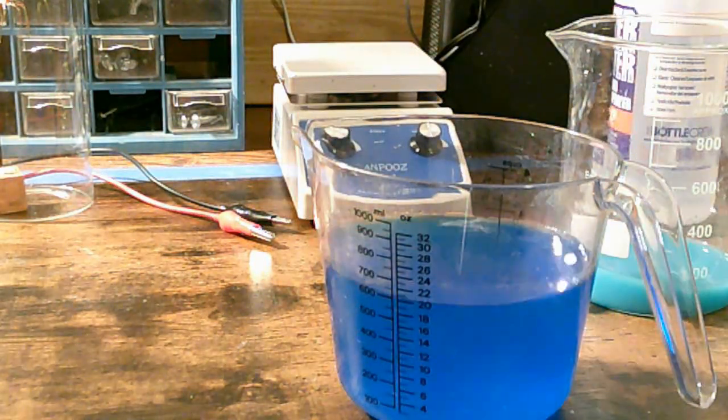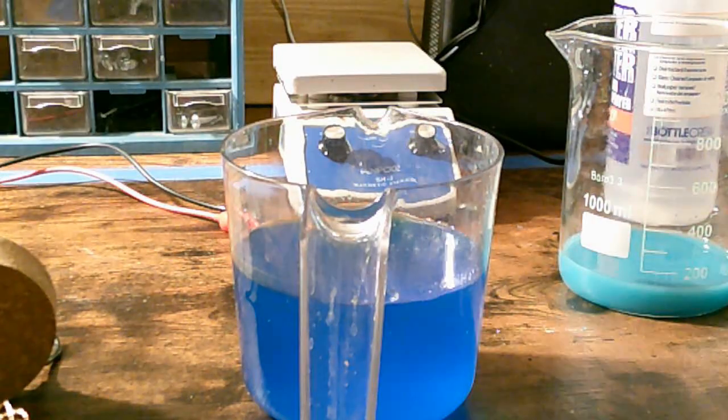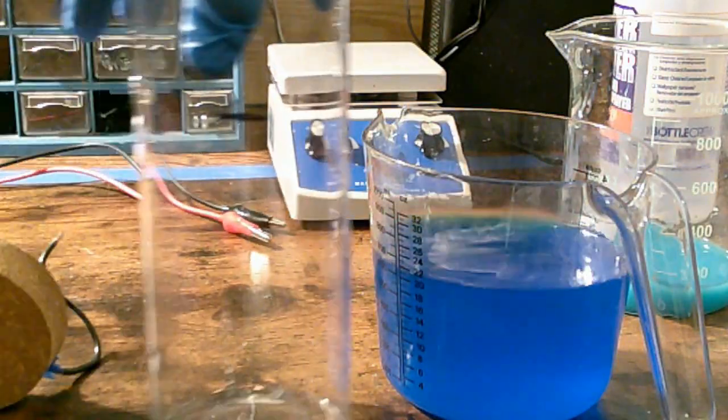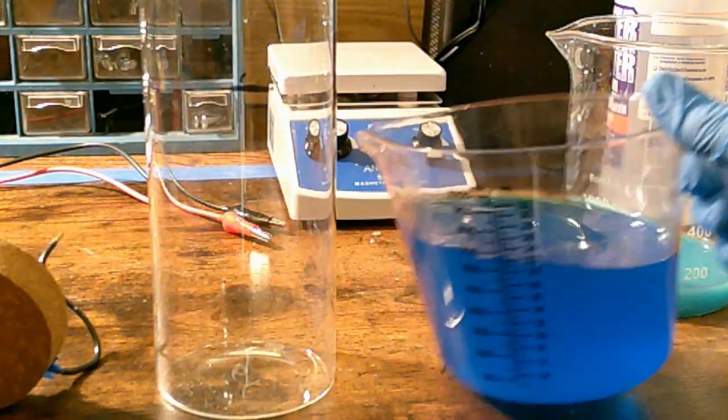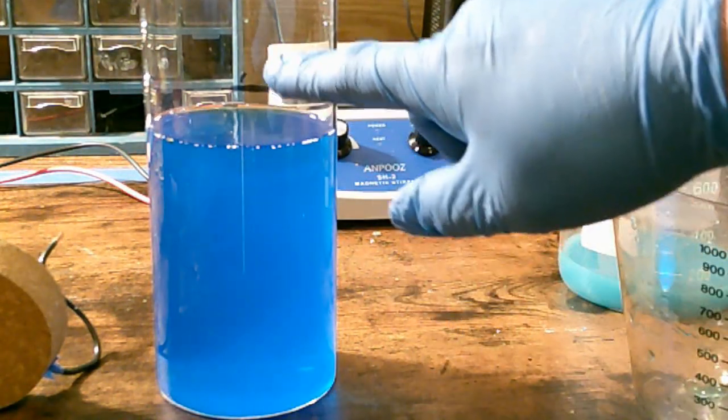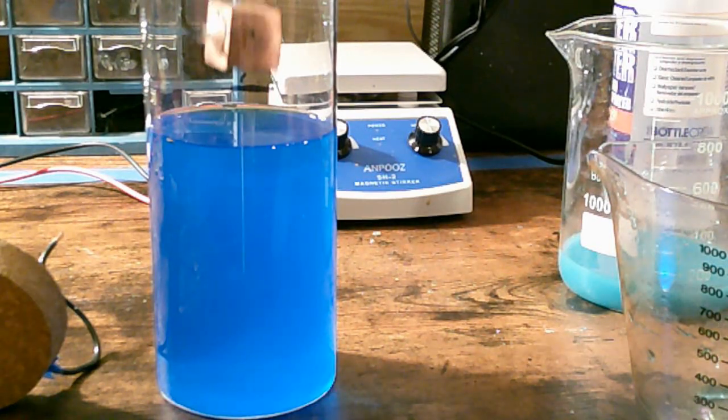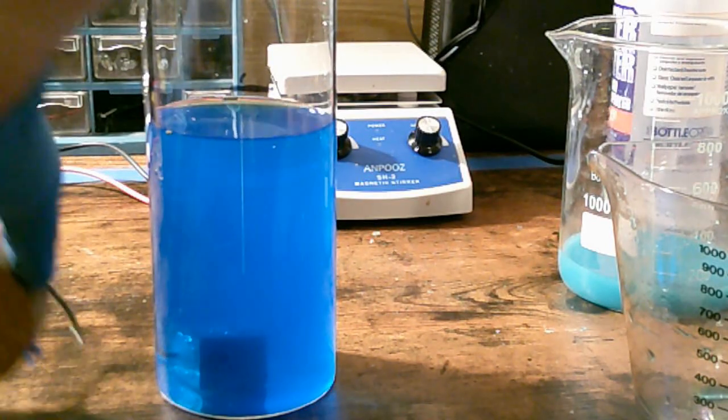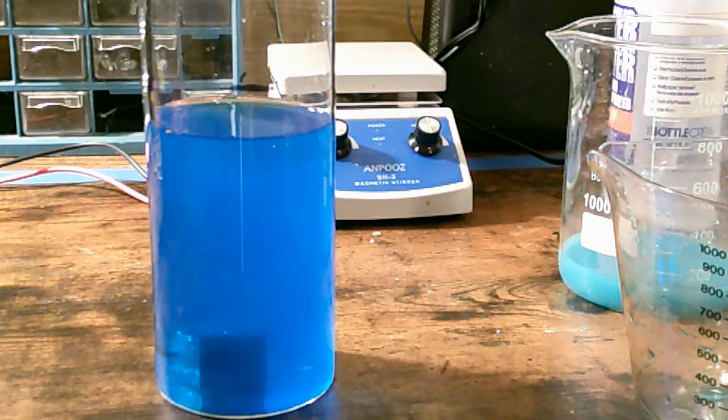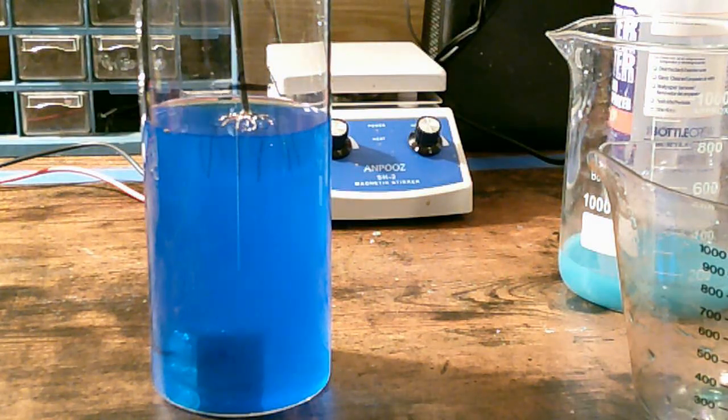And this is my good goo-free solution. Now I literally have to just pour it on in. A little bit low. This is the one that I want to be at. But it's pretty darn close. I'll put the anode in. The cathode will be in the solution at that point, so I can do that as well.